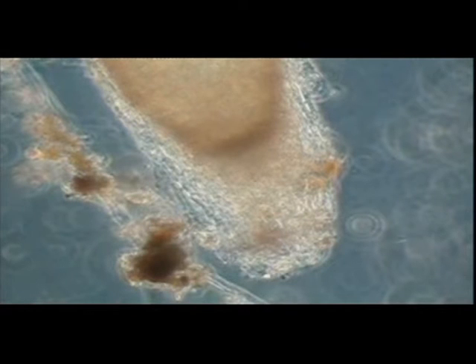I used soil from my garden at Viewfield Midmar for these experiments. Large boiling tubes were filled with this soil to a depth of 3 centimeters, and microscope slides were placed on top of these soil samples. The boiling tubes were then filled with sufficient of Hoagland's plant nutrient solution to cover most of the area of the slides. Plant seedlings or root segments of Scots pine, that's Pinus sylvestris, or white clover, Trifolium repens cultivar Huia, were attached to the slides with Teflon tape.